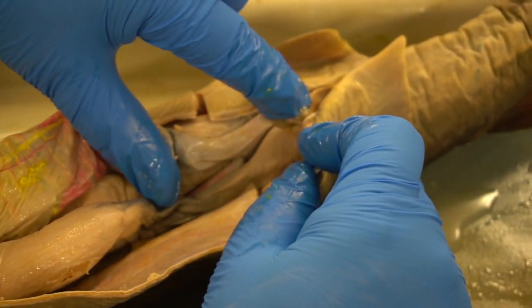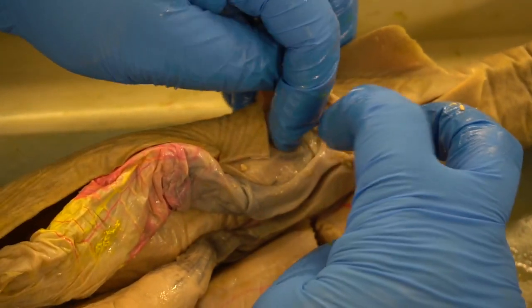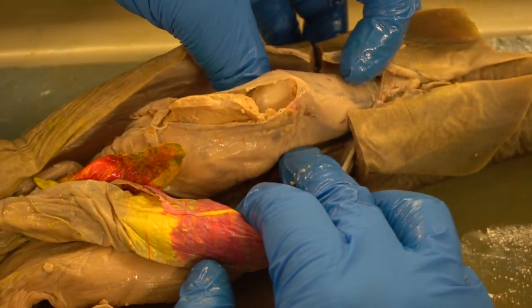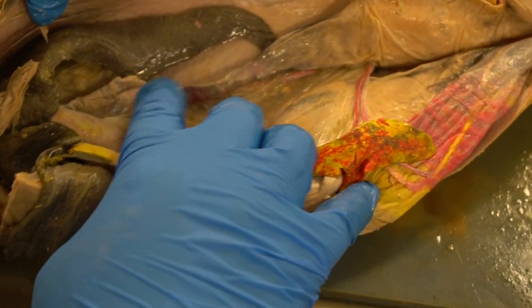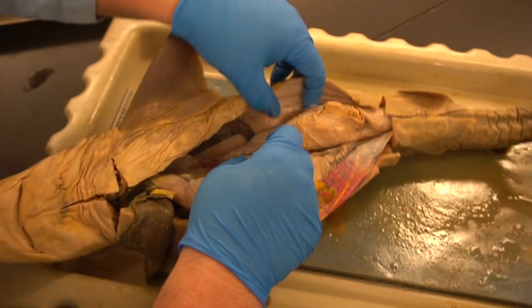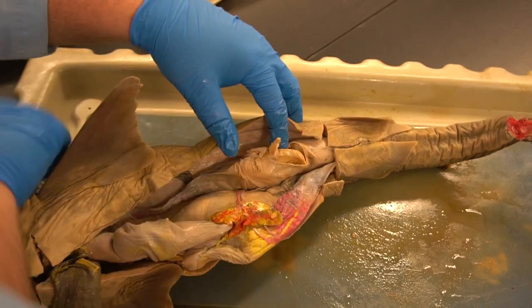Now, this is bilateral, so you have it on the right, and behind on this side you would see it on the left. I'd have to move this stuff out of the way. Ooh, we busted open this side of the ovary. You can see some stuff in there. So you have all the same stuff on this side: ovary, oviduct, and uterus.